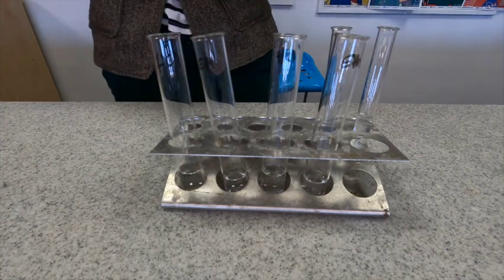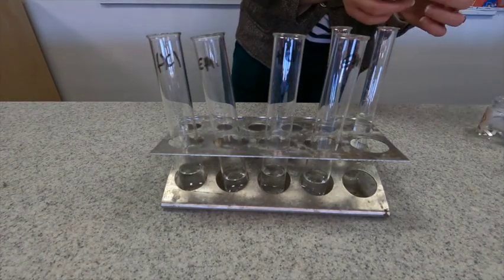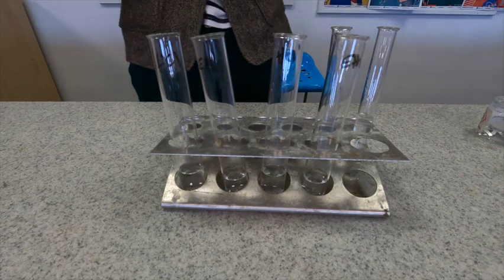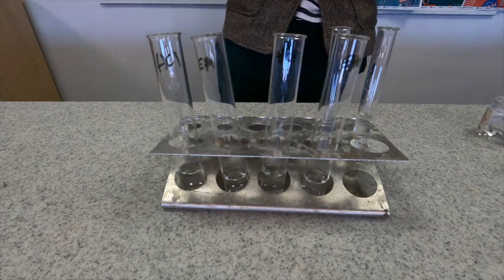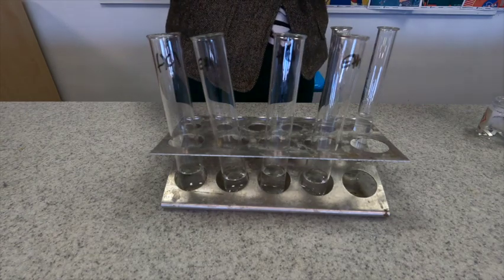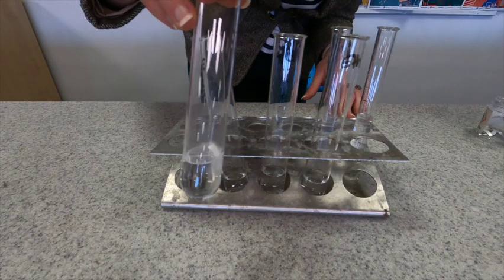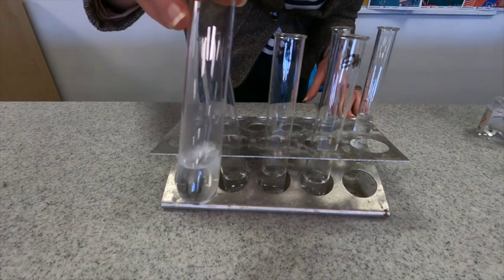First of all I'm going to add two pieces of magnesium into my hydrochloric acid, making sure that in a second when I do ethanoic acid I add the same number of pieces. So I'm going to add them in and we can take a look. We can see some quite vigorous fizzing.